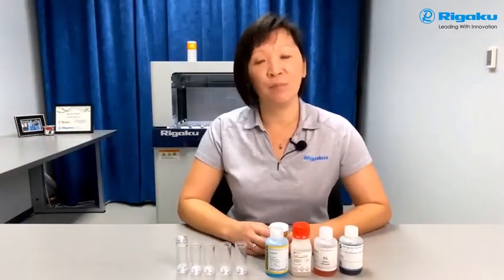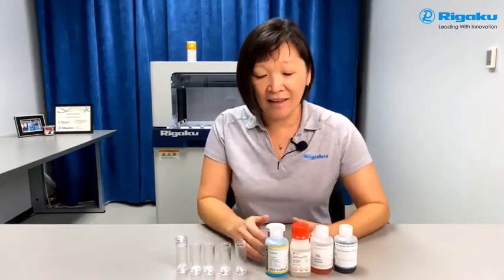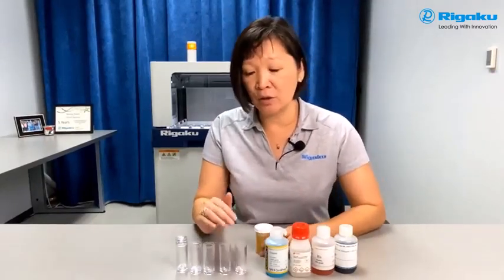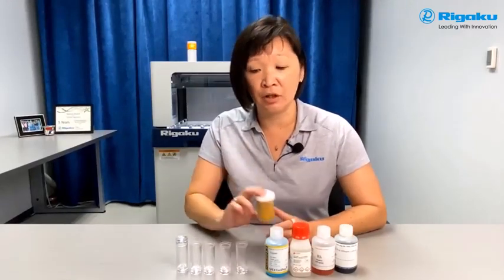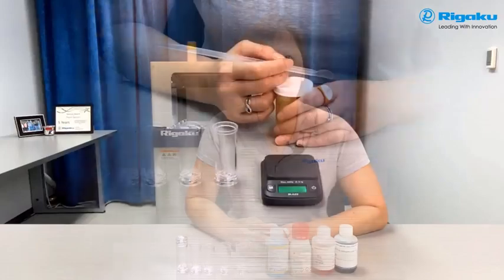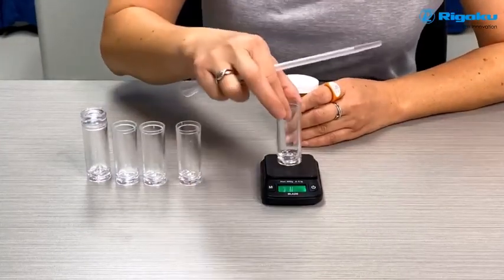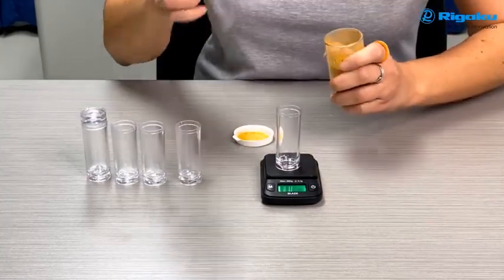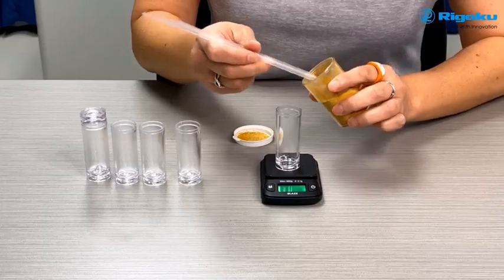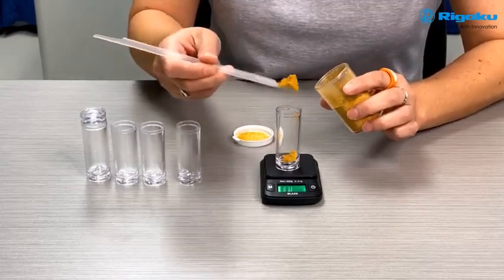So what is involved in building a calibration curve? First thing you want to do is identify your ICP standards of interest, and this is what you're going to spike into your standards. We also have mixing vials here to put your base material in to create your calibration curve. The first step is to weigh out your base material into these mixing vials so that you can spike your ICP standards in there to make your standards. And you want to do this consistently for each of your standards into the mixing vials.